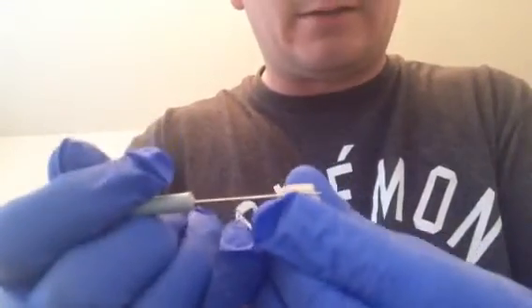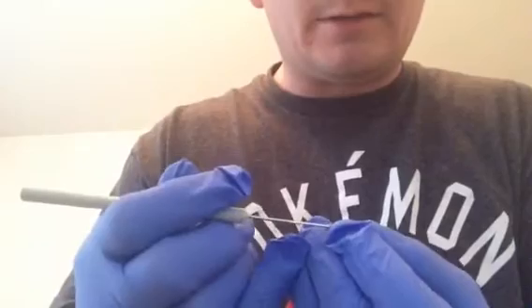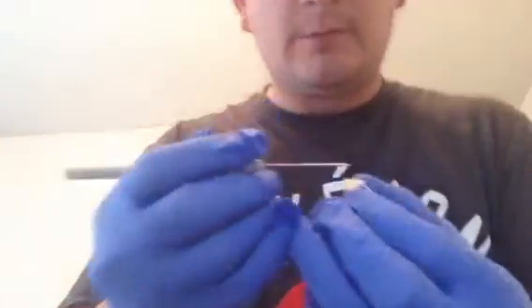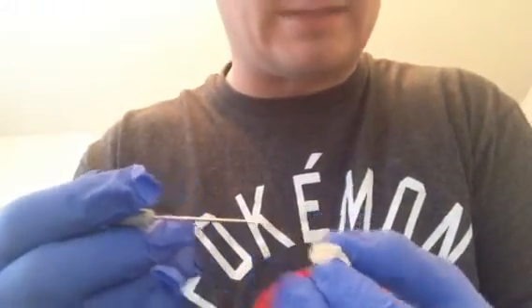sit. The glove's getting in the way here. I don't want to drop it. Okay, the center section here, lowered. Hold on. When you pinch it together, you can see where that aqueduct actually lies. It's not as prominent because, again, we cut it down the center, so I may have gotten that aqueduct cut in half pretty well. The arbor vitae is actually the white matter of the cerebellum.